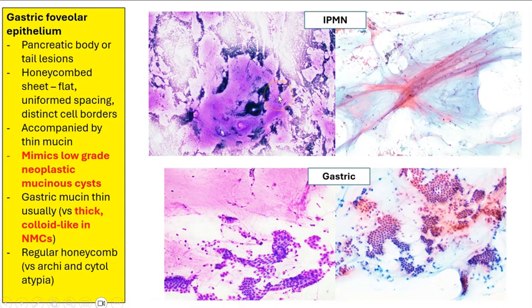Here is the comparison of the thicker mucin that we will see both in the air-dried and alcohol-fixed smears in an IPMN, as opposed to the thinner mucin that we will see in contaminant gastric epithelium. But sometimes it's not so obvious and it can be quite challenging to tell apart.